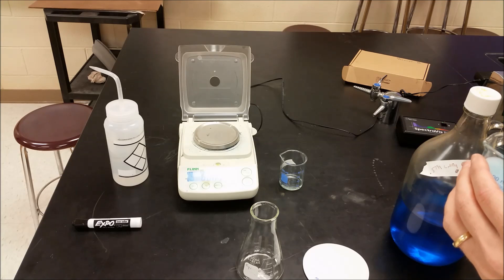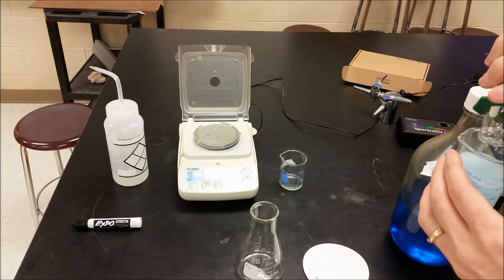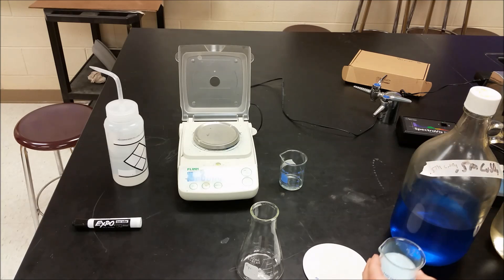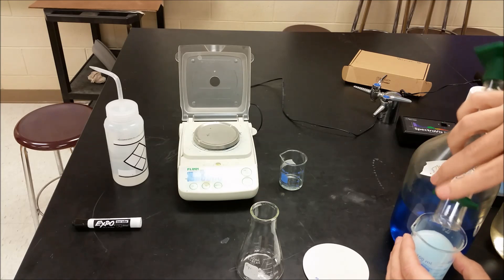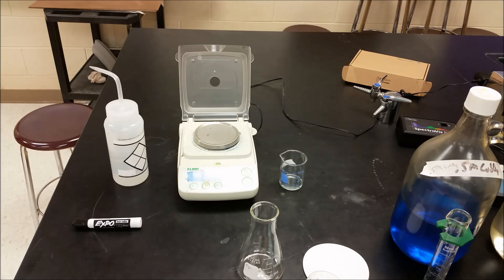Mix the two. Okay, and when I mix those you see that precipitate forming. Make sure I get all of it there. And just a quick little bit just in case, I want to give plenty of excess of the barium.